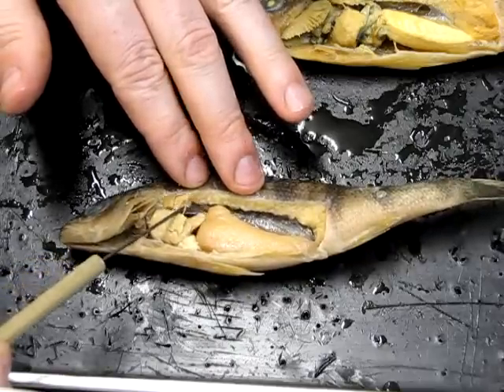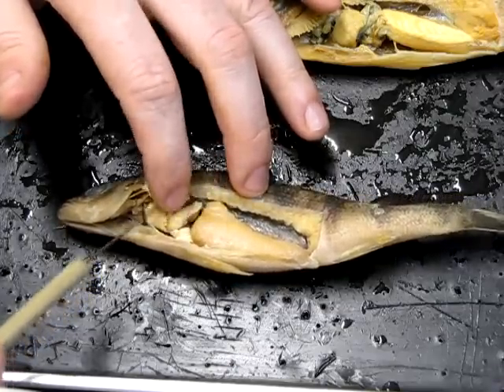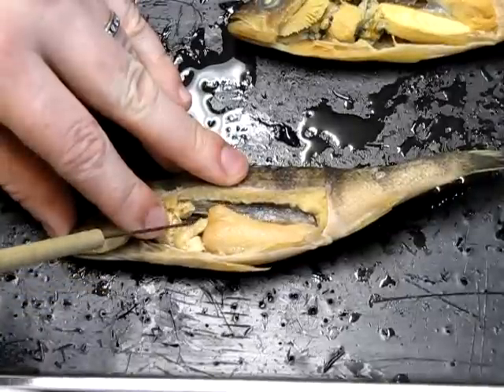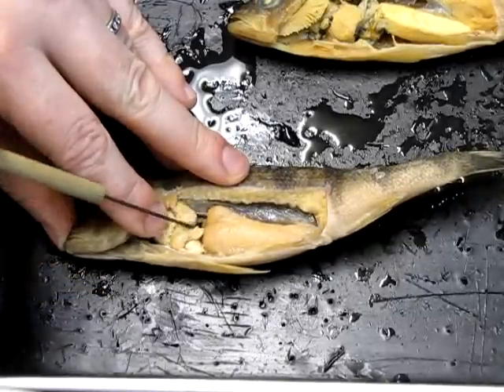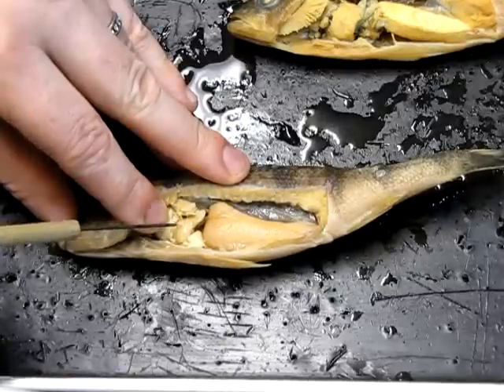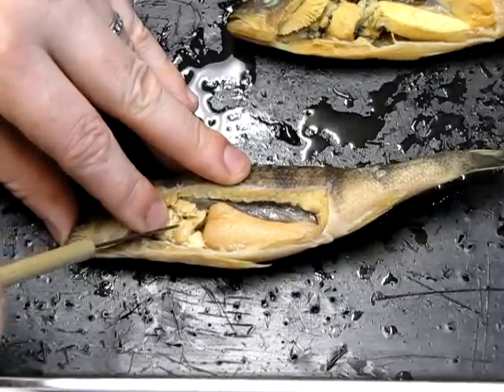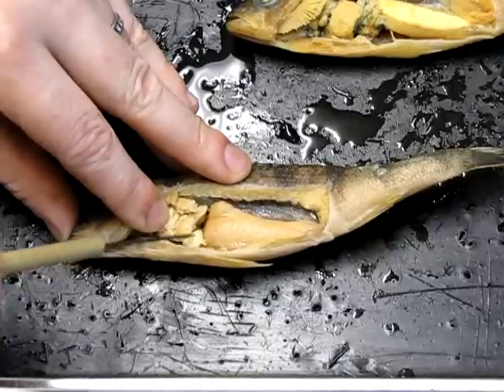Moving the liver out of the way, we can see what's underneath. This prominent sac sticking out toward the rear is the stomach. You can also see at least one of the finger-like projections associated with it — those are the pyloric ceca, and there are several of them.